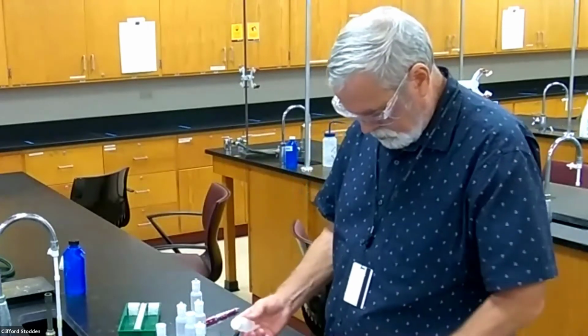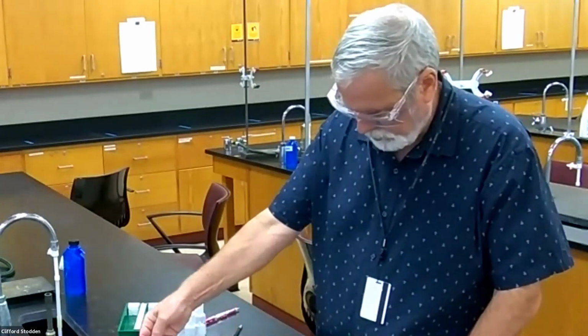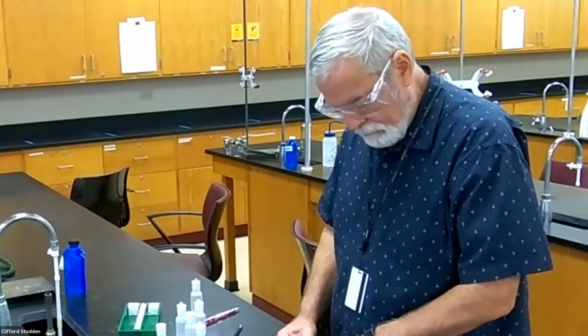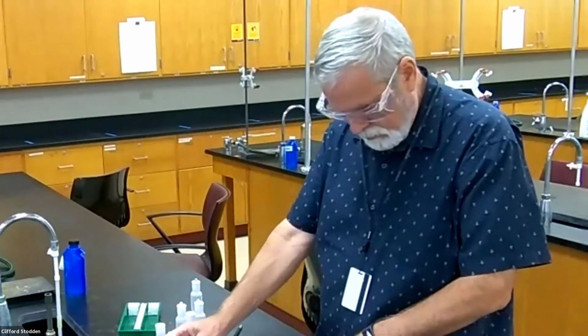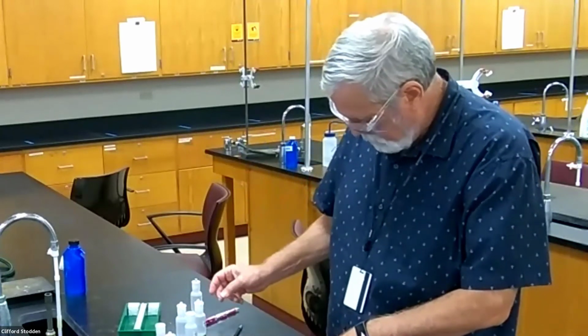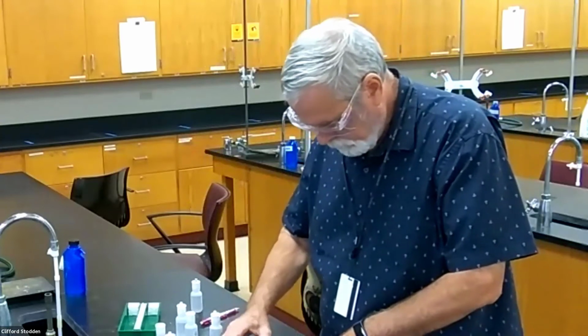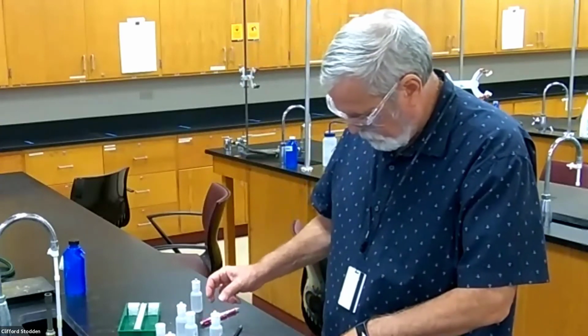But we'll just see what it looks like. Very, very milky. Then sulfuric acid. Nothing there. Then ammonia. Possibly. And then with sodium hydroxide.